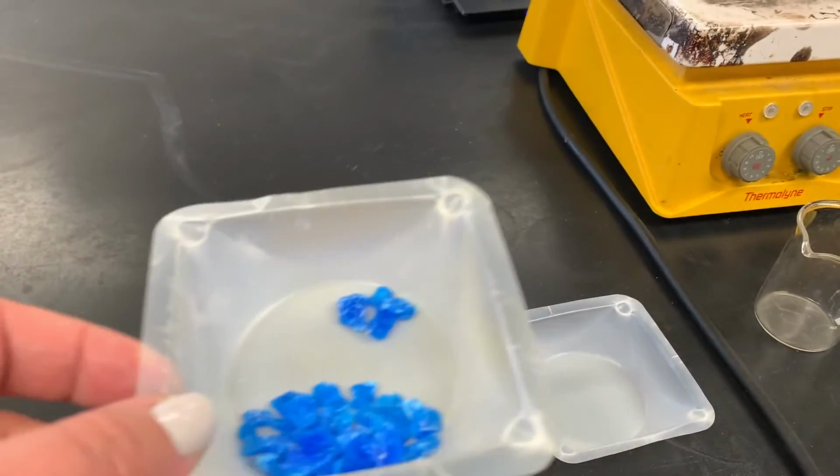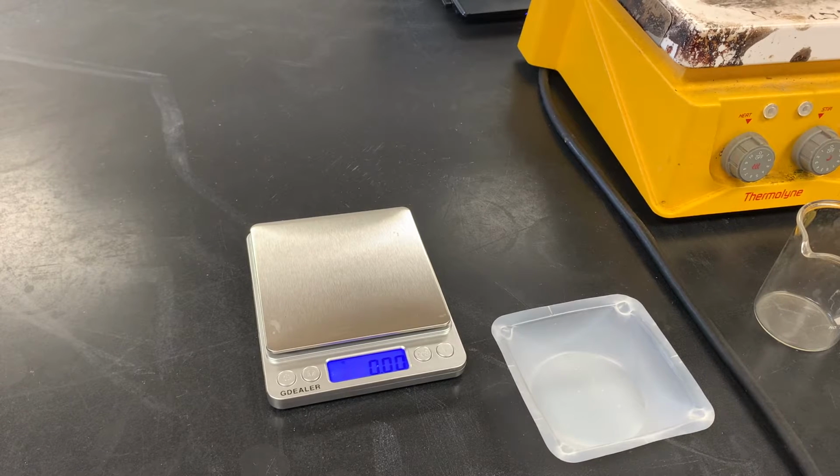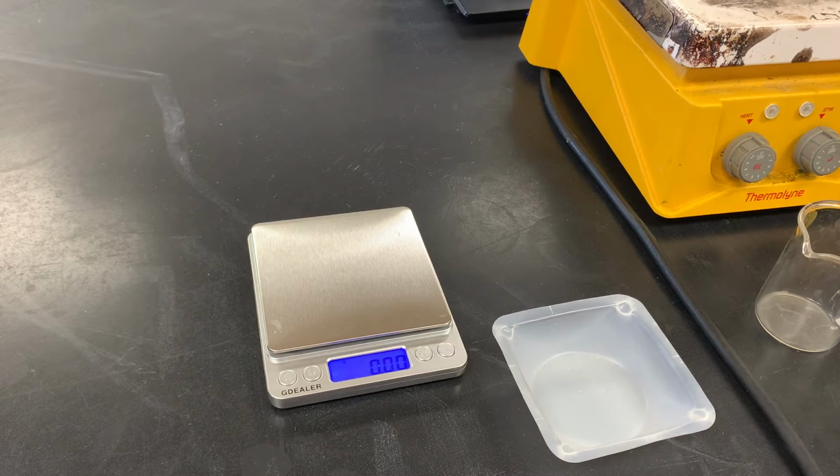So we are going to take this and we are going to dissolve it into our solvent, which in this case we're going to use water. Okay. So we are going to look at the process of dissolving. We've already started to dig into what's happening at the chemical level when things are dissolving. So our goal with this lab is to look at some of the variables that come into play and get a little experience changing variables, measuring variables as we go through this process.